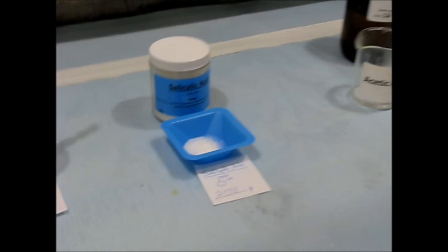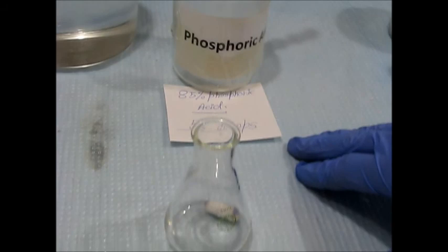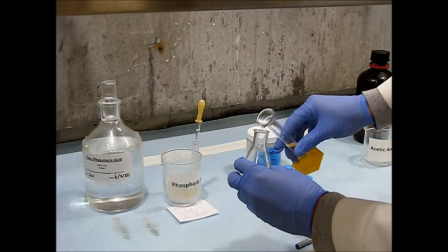So we've already weighed out our salicylic acid. So we'll just go ahead and add that directly into the Erlenmeyer flask.